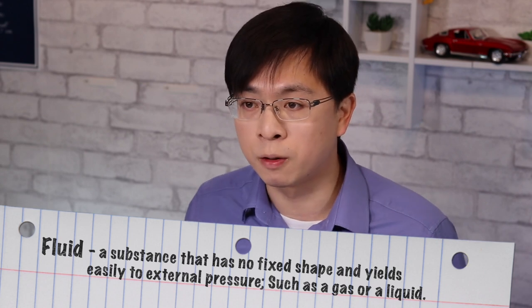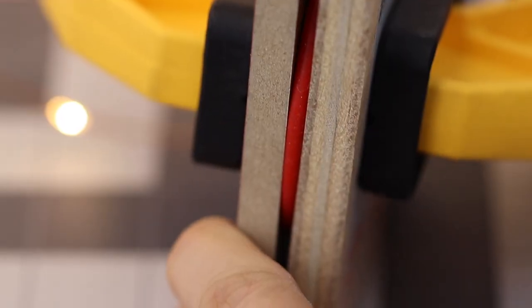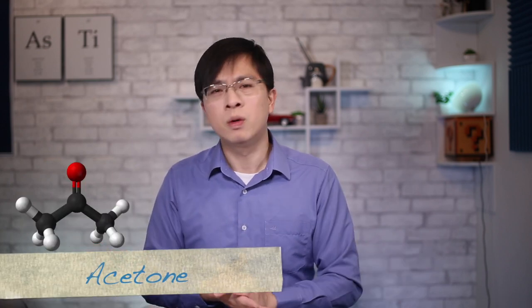Let's bring up the definition of fluid: a substance that can be easily deformed or doesn't have a fixed shape, and yields easily to external pressure, such as gas and liquid. So take your O-ring and apply pressure on it — squeeze it. Rubber is just a viscoelastic material by definition. The rubber still retains fluid characteristics, and will thermodynamically mix with other fluids. So the solvent, as in the experiment with acetone, will diffuse into the FKM rubber 3D network.